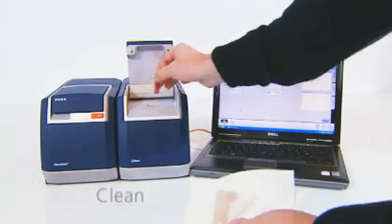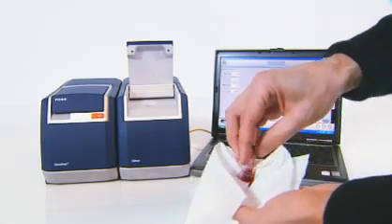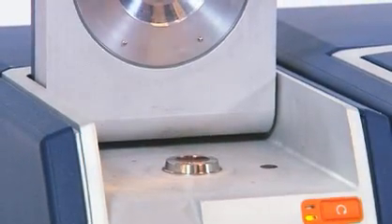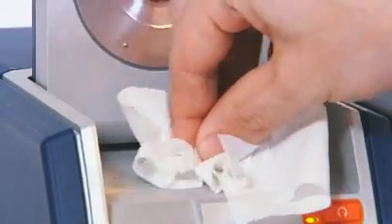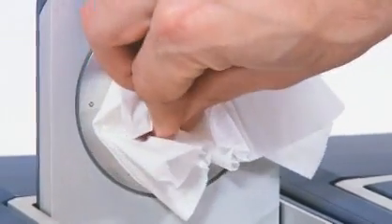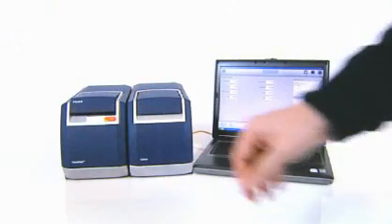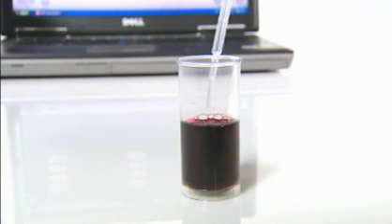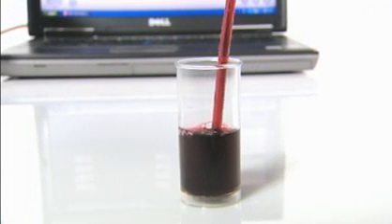Empty the color sample holder and rinse it well for reuse. Clean the sample cup and the matching area underneath the lid. A regular tissue moistened with tap water works fine. Change the pipette and you're ready for the next test.